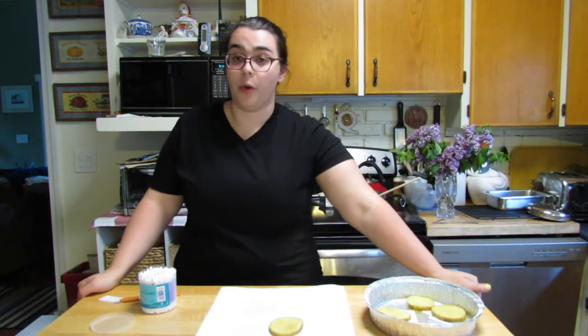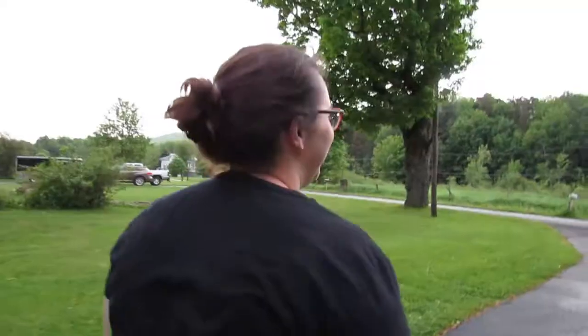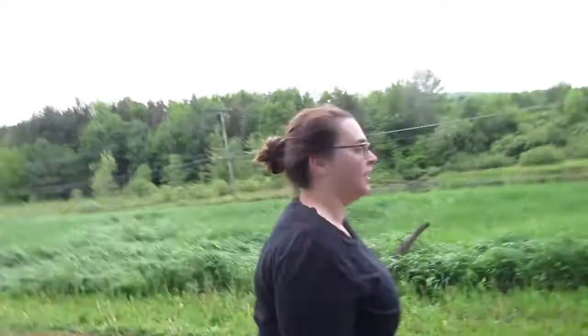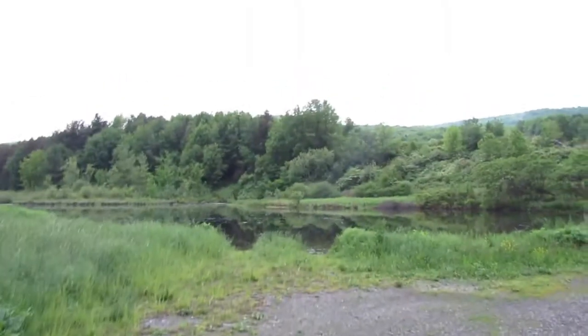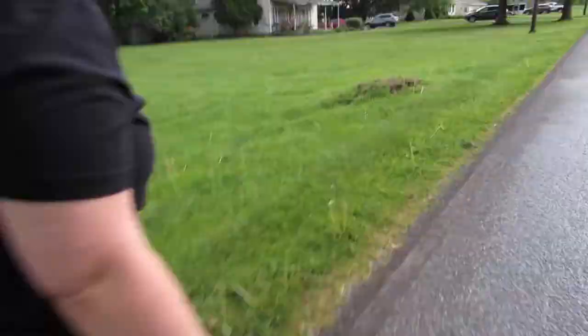The last thing I'm going to do is get a pond water sample. There is so much bacteria in pond water. There's a pond across from my house, so I'm going to get a sample from there and see what grows. Come on, Jenna — I'm going to get some from the pond. It's for science. I'll swab it and label this one 'pond water.'